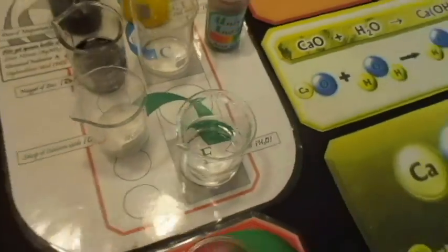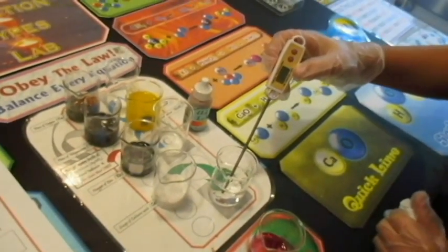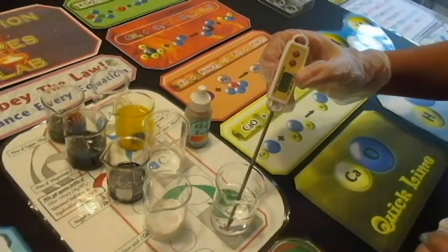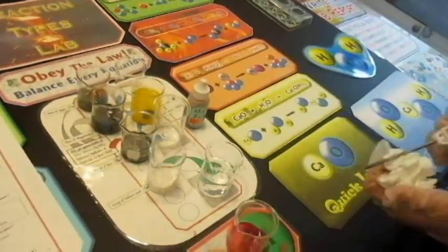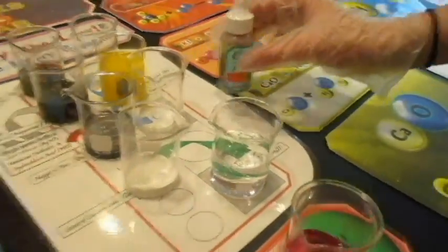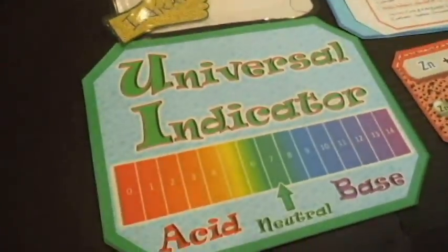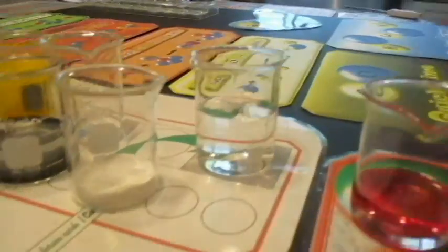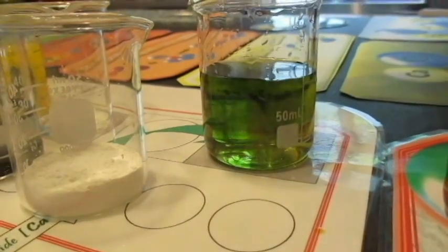Okay, take the temperature of the water right now, Lucy. Get the temperature before, and then we'll talk about the reaction. It's at 23.7 Celsius. Good, 23.7 Celsius. So Giovanna's going to add the universal indicator to the water. What color would you expect it to turn? Green. Okay, that's what we'd expect. Let's see what we get. Put a good squirt in there. Oh yeah, that's a nice green.